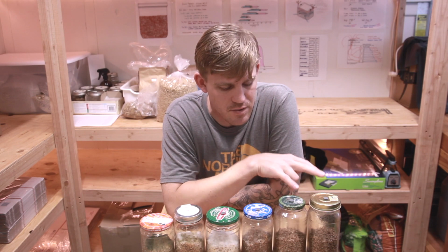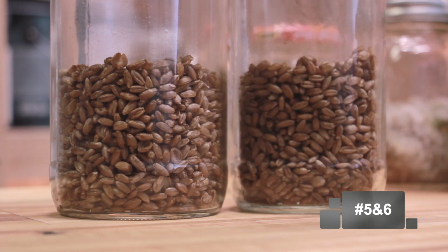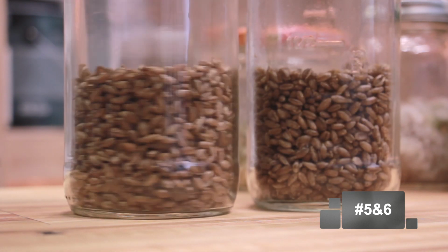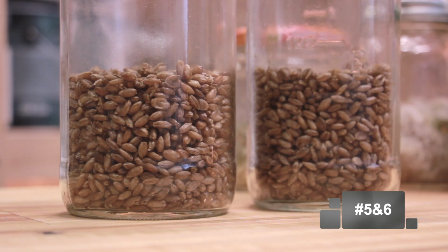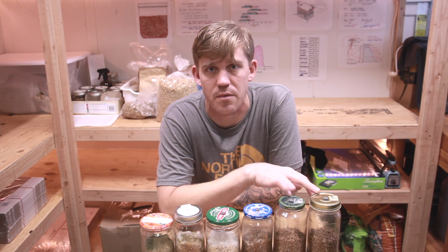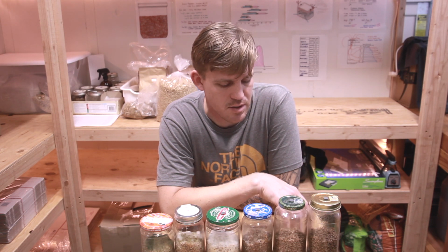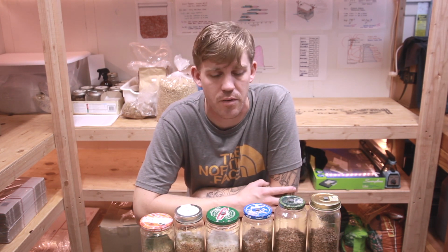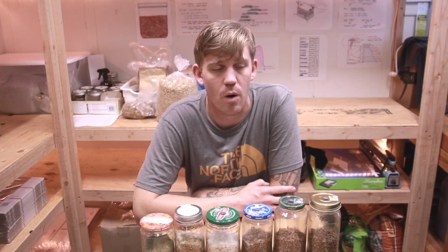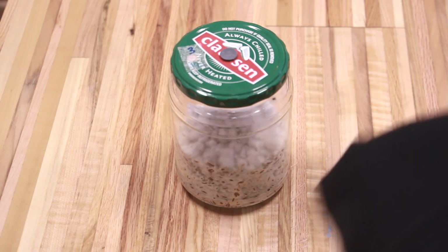And then jars 5 and 6, the grain still looks clean. There's no contamination or anything in there. Obviously no hyphae growing from the blue oyster either though. I have pink oyster going on some other jars, also lion's mane on some other jars. So I'm just going to do a grain to grain to save this grain instead of wasting it, because I still think it's viable. Nothing's contaminated there, so I don't want to lose all that grain, so I'll move that on to a different experiment.